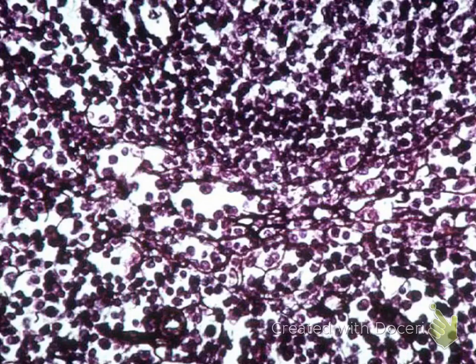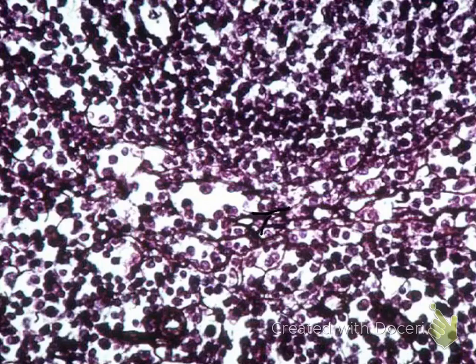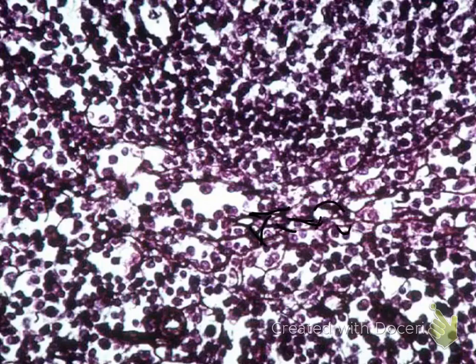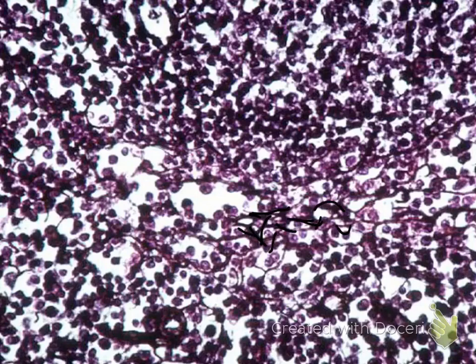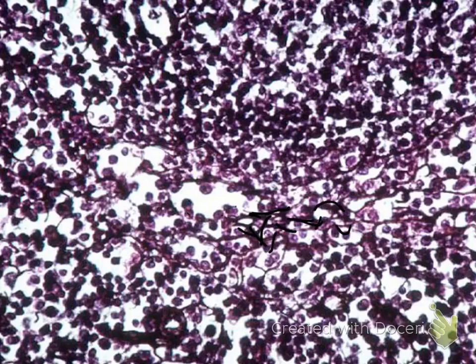The first thing you should notice about this tissue is it looks almost like cherry blossom trees — Japanese cherry blossoms. All of these tiny, branchy-looking structures are your reticular fibers, and all of these tiny dots are your reticular cells. So this is your reticular connective tissue.